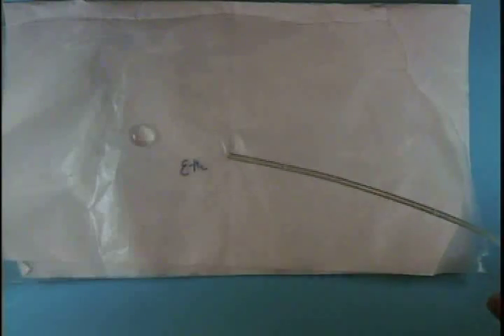Okay. The hexane is basically flat. It's evaporated completely. It's completely flat. The ethanol has a little bit of a bump right here. You can notice that. And the water, let's have some fun with the water. Okay? So the water, I can take and move around on the wax paper.